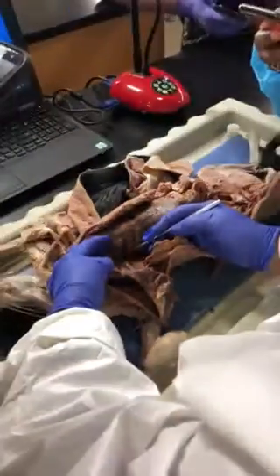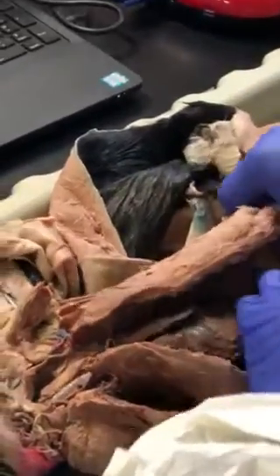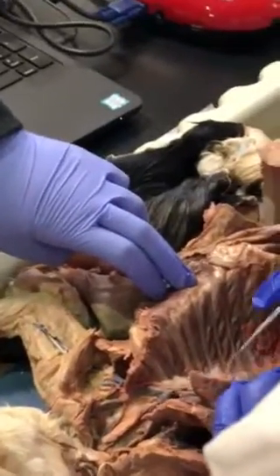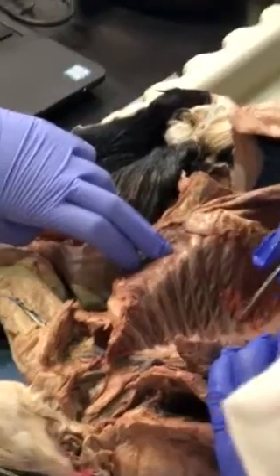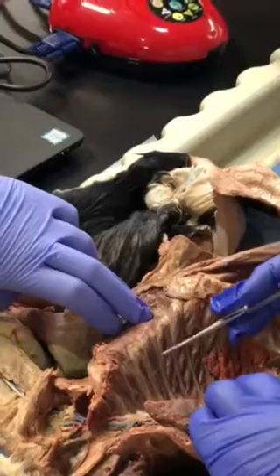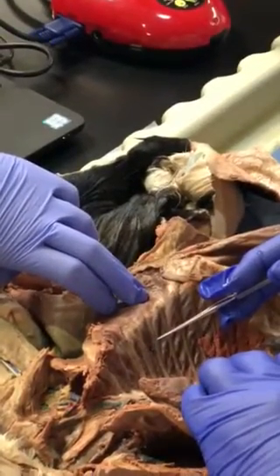Intercostal means in between the ribs. On the other side, of course, we have the aorta. This is the aortic arch where it branches into two. Those arteries branching from it going into the ribs are posterior intercostal arteries.